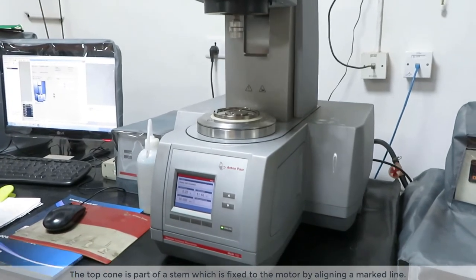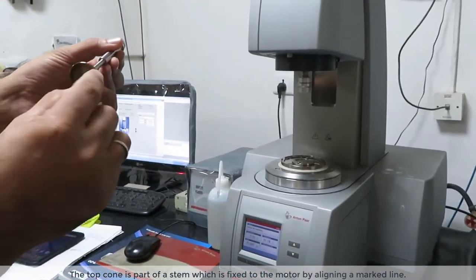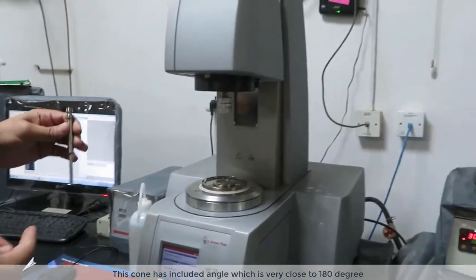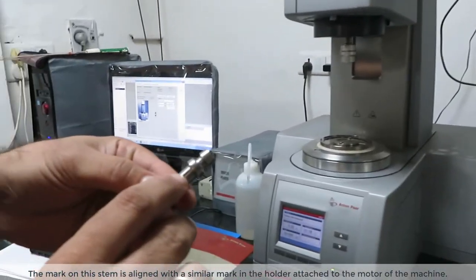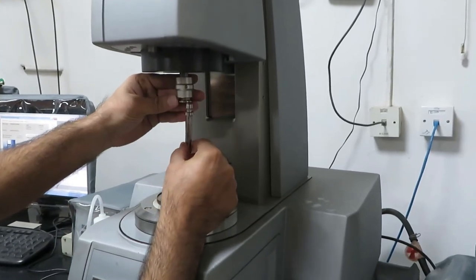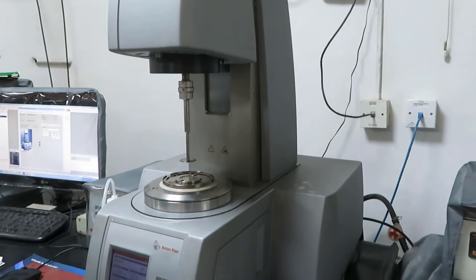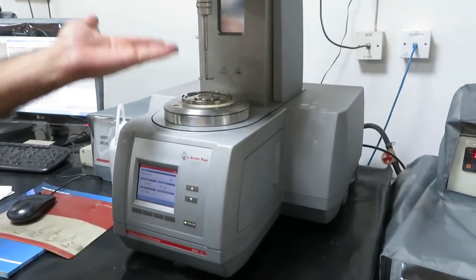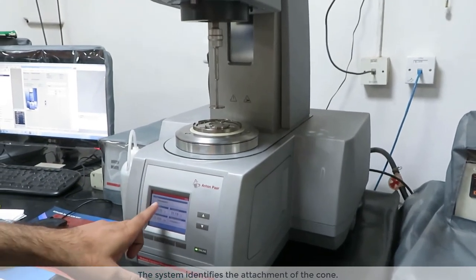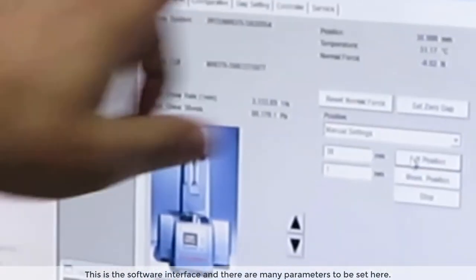The top cone is part of a stem, which is fixed to the motor by aligning a marked line. This cone has an included angle very close to 180 degrees. The mark on the stem is aligned with a similar mark in the holder attached to the motor. The system identifies the attachment of the cone. There are many parameters to be set here, and the position of the cone is first set to zero using the software interface.